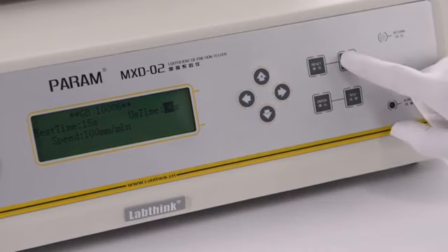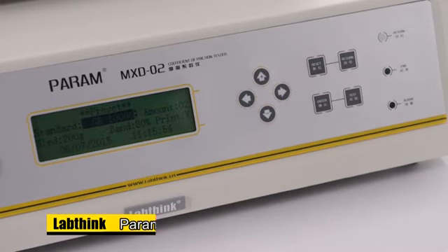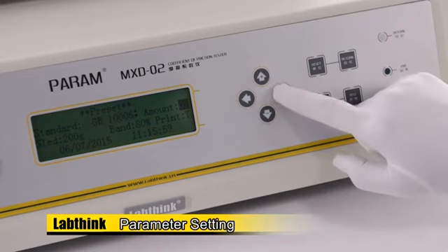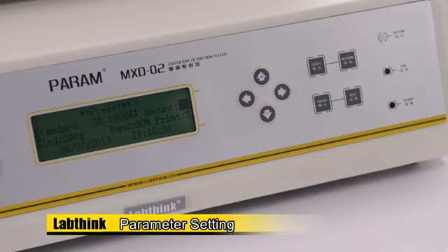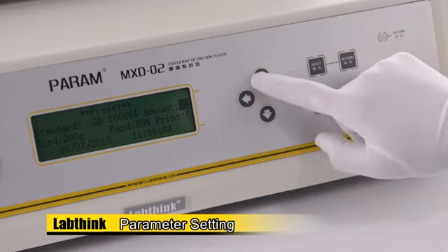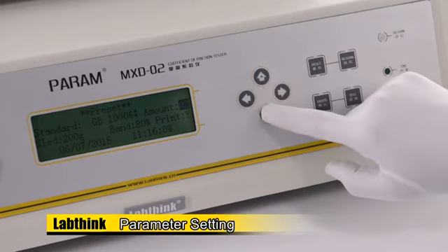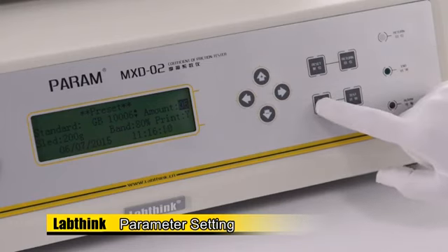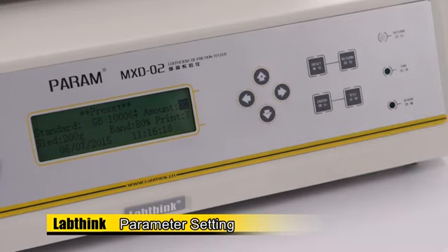Press Return to return to the preset interface. Set amount as required and press Enter to save the setting. Set sled as 200 grams and press Enter to save the setting.